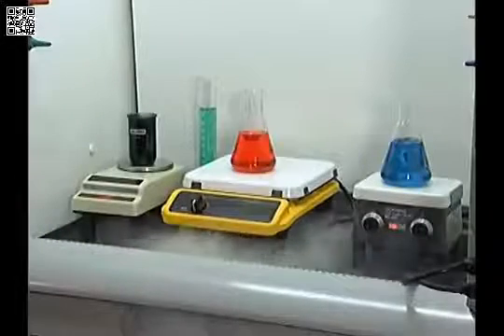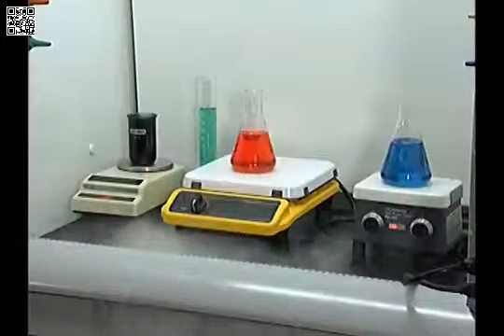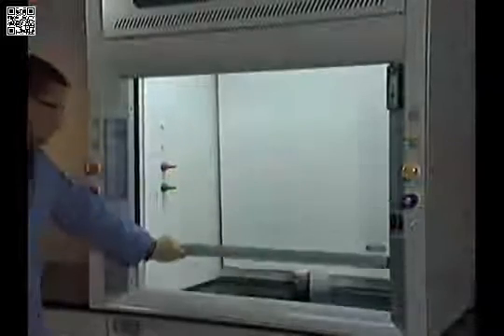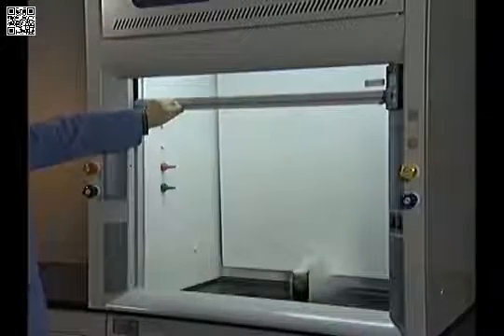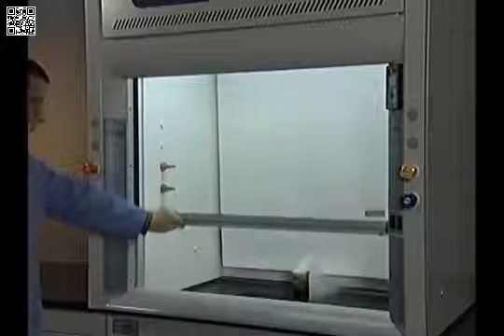Apparatus should be elevated on blocks to allow air to flow under it. Abrupt movements can cause turbulence, allowing fumes to escape. The sash should be lowered or raised gently.